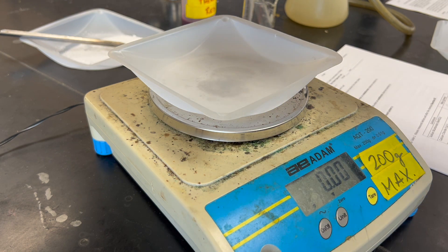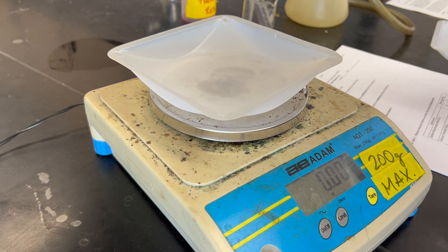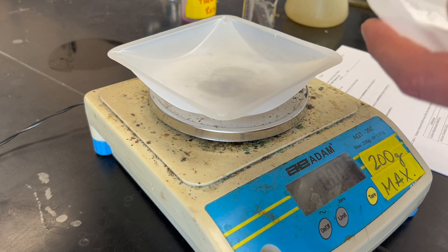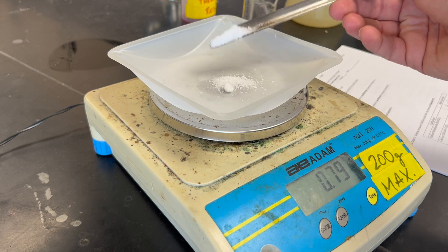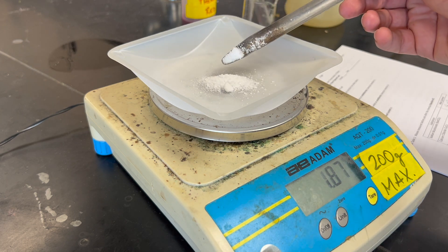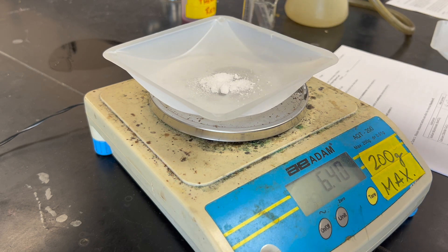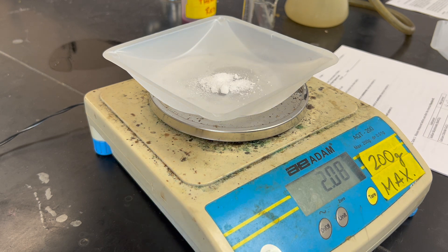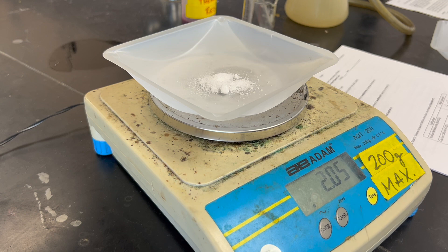In a second weighing boat, we're going to measure approximately two grams of calcium chloride: 2.05, and we're going to put that aside.